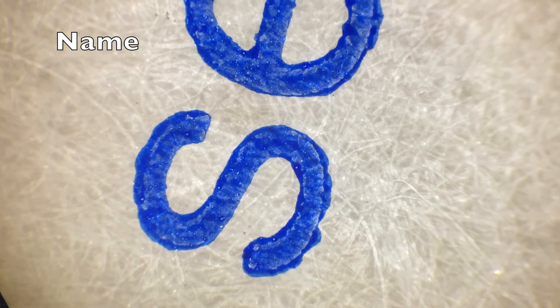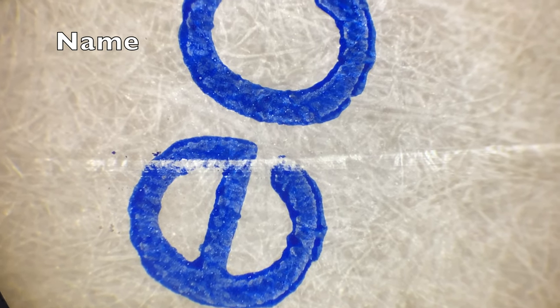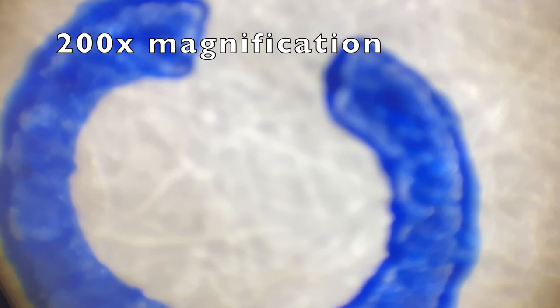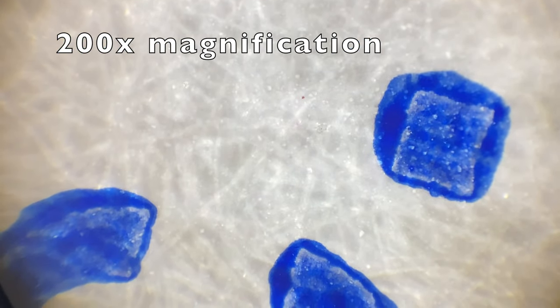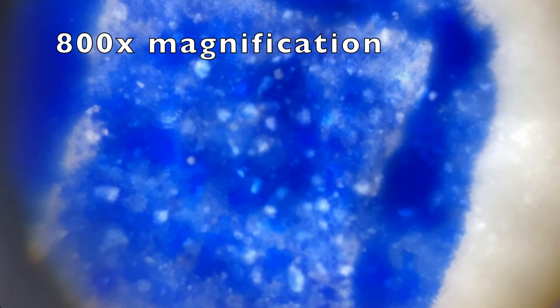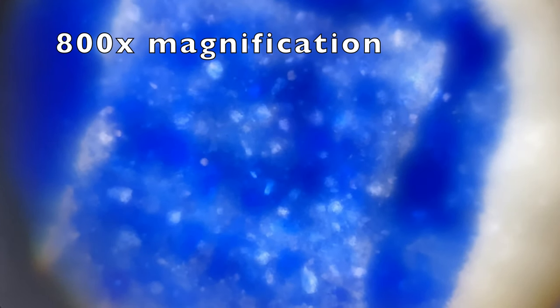For a reference, here we see the letters S-E-C with a period at the end. This is a font approximately somewhere between an 8 and a 10 — I'm not 100% sure, but that is my best guess. Here's the period at the end of a sentence under our highest magnification.